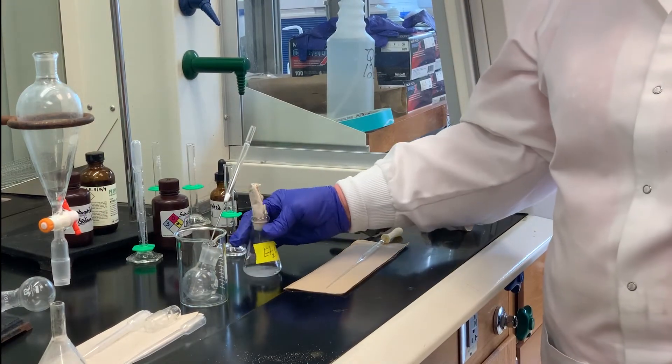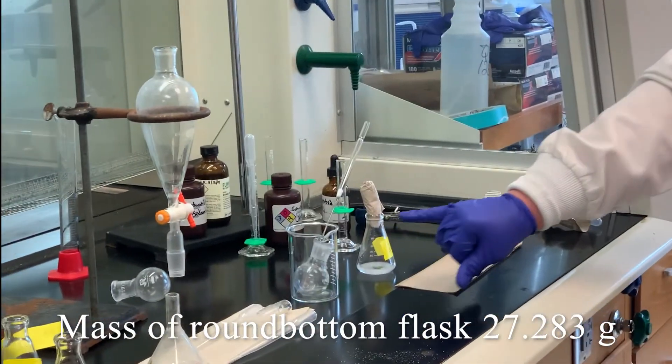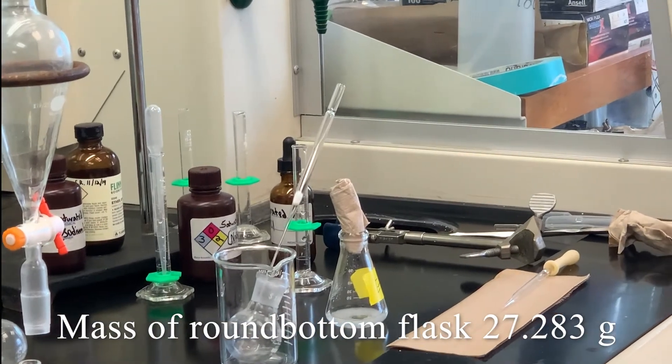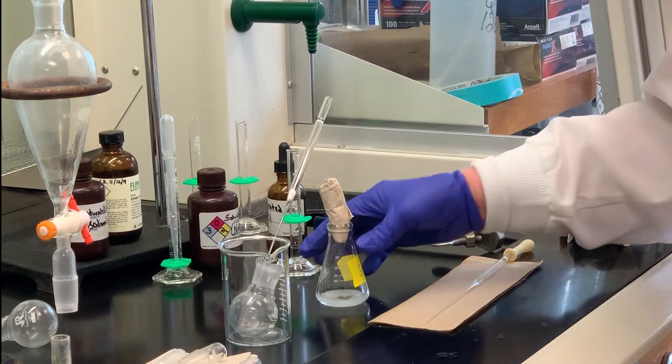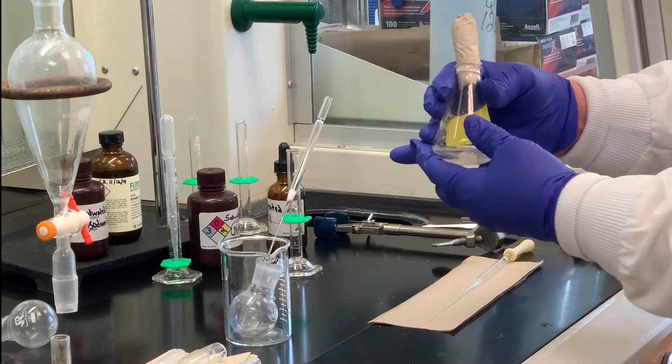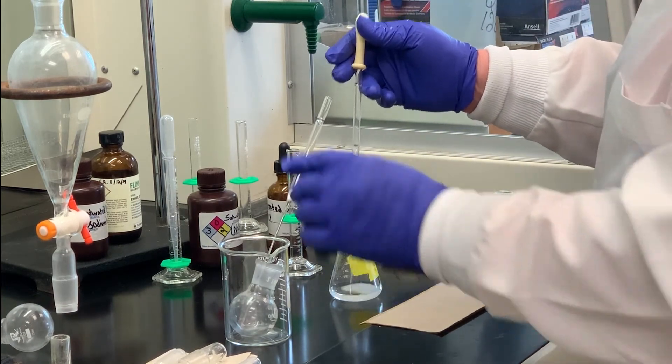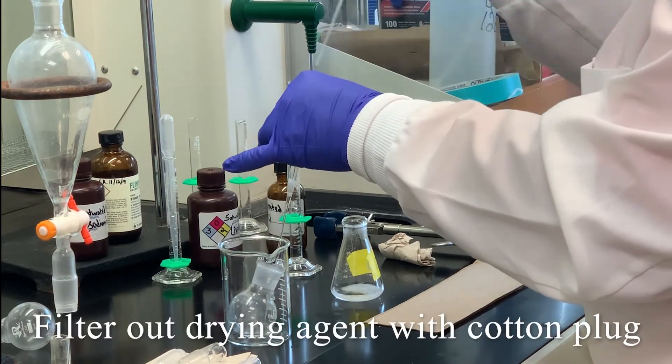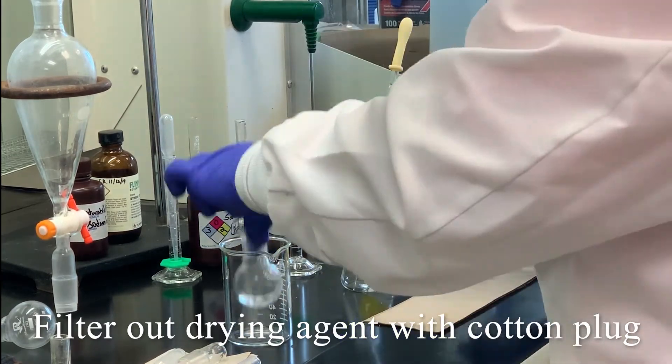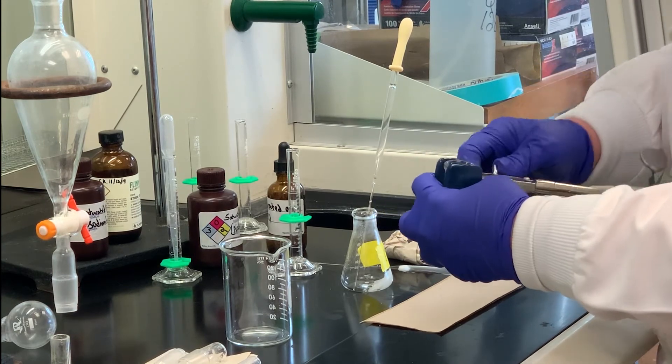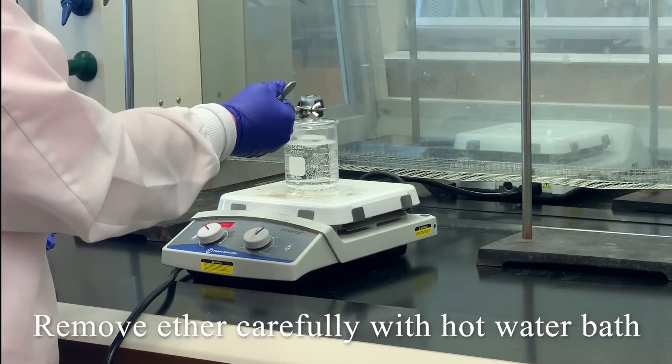It's been 10 minutes since we've dried the ether layer. So what I'm going to do, I went ahead and weighed a round bottom flask and the mass of that round bottom flask was 27.283 grams. And notice I have our standard pipette with the cotton plug in and I just don't want to filter any or decant any of the drying agent in there. So we will go through the transfer filtering through the cotton plug.